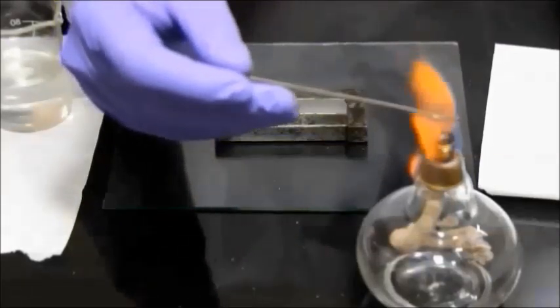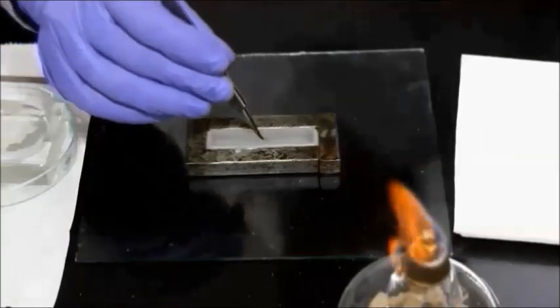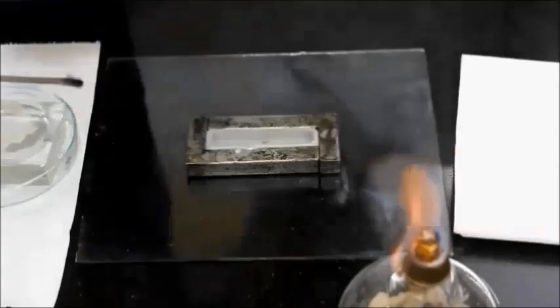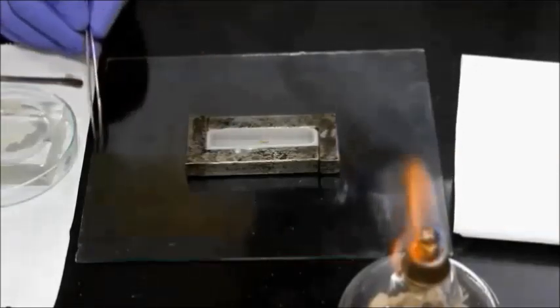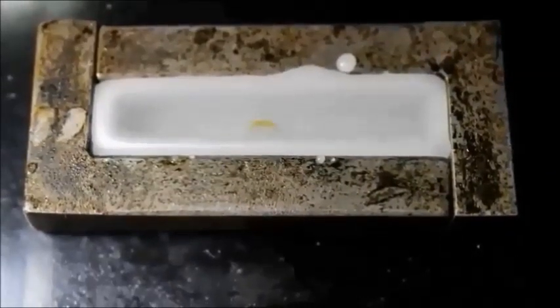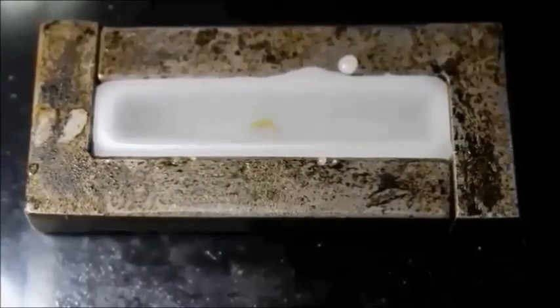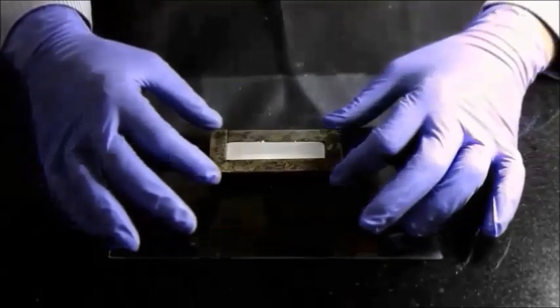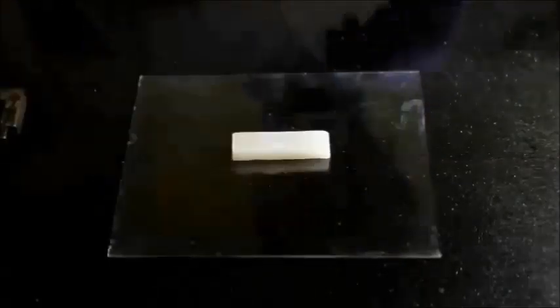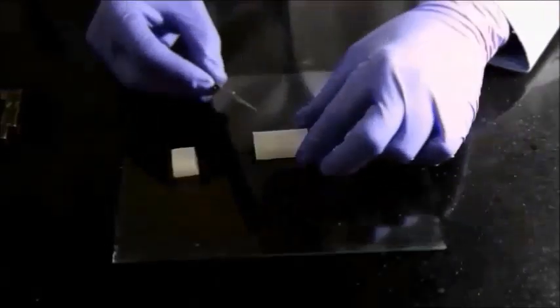To get a vertical section or transverse section, the tissue is placed in the wax accordingly and left to solidify. Plastic blocks are also used for the casting. After 30 minutes, the block is trimmed to remove excess wax so the tissue can be seen from outside.